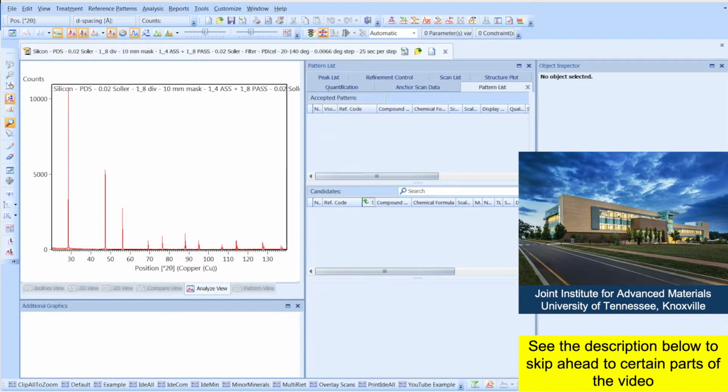In this video, I will show you some options for what you can do if your database in Highscore Plus does not have atomic position information. This video assumes that you have some experience with Highscore Plus or have watched one of my other longer tutorial videos, such as phase quantification.